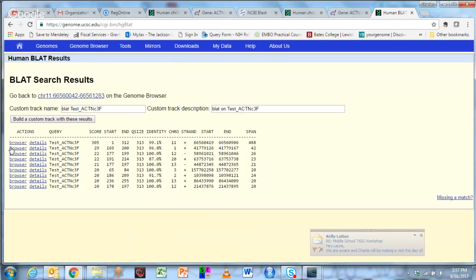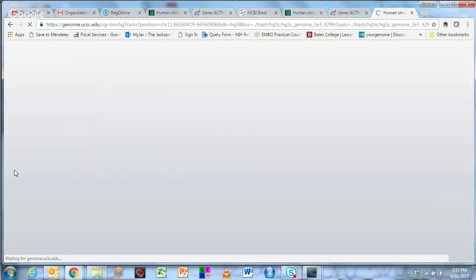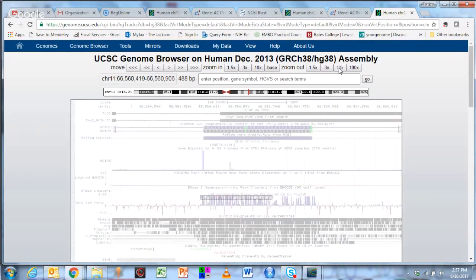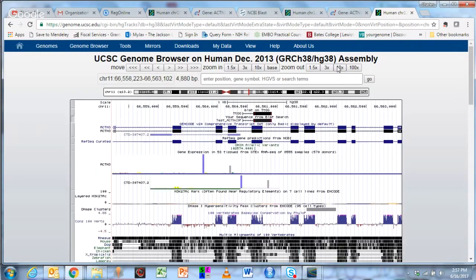This actually works fairly fast. It's a small fragment, and this puts the sequence in the context of the genome. So you can see here, these are our sequences, the tests. I've done this before, and it remembers that I've done this. You can see here, these are tracks or linear representations of the genome. I'm going to zoom out tenfold. This is a way to show students that your PCR product is in the context of introns and exons.